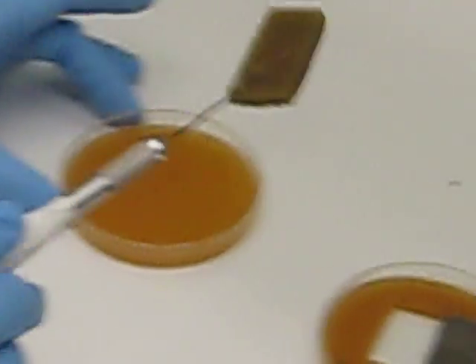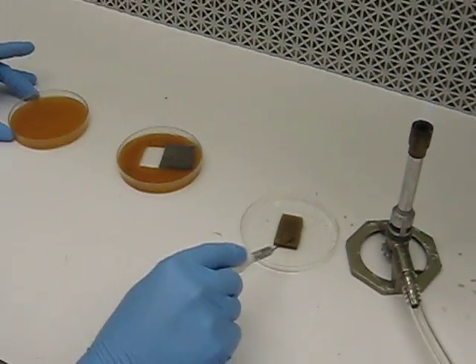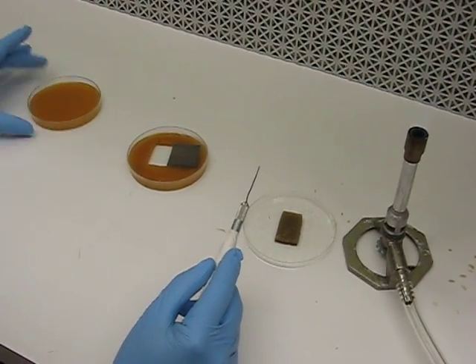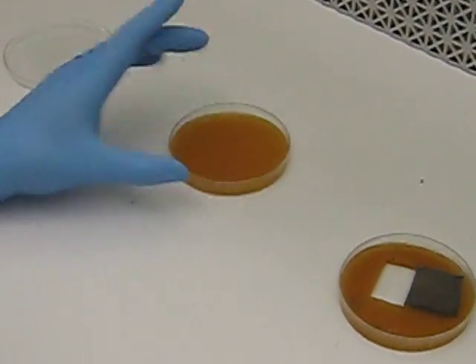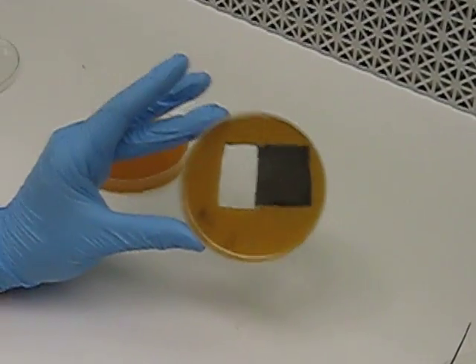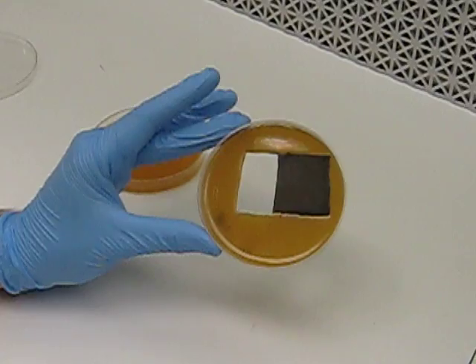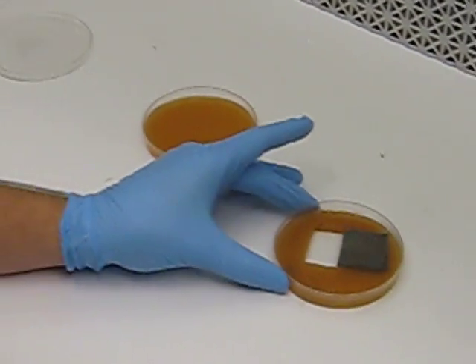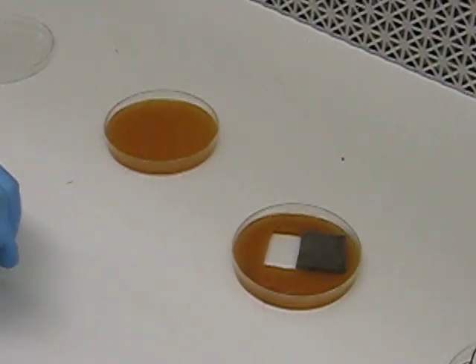When I'm done, I pick up the piece like this and discard it on a waste tray. In four days, this culture, when incubated in the dark at room temperature, will look like this. You continue the subculturing process every four days onto clean, sterile V8 media.